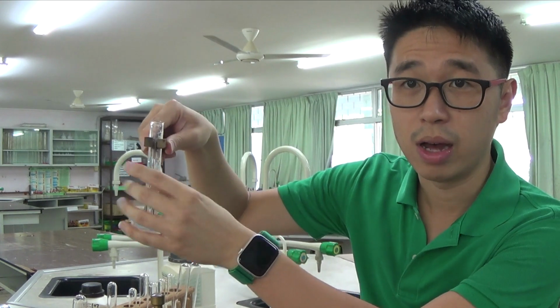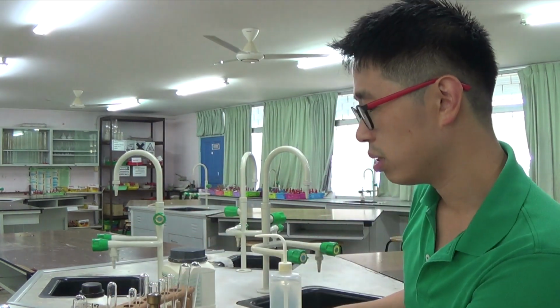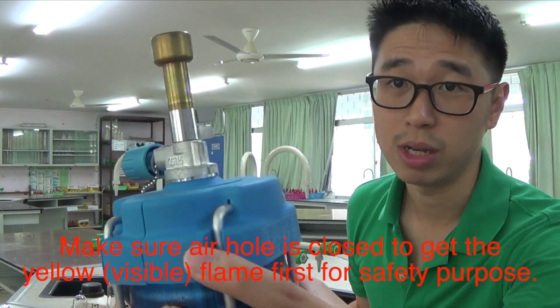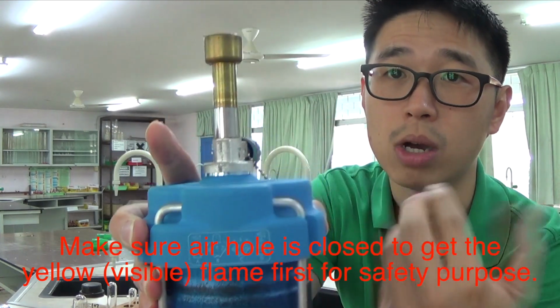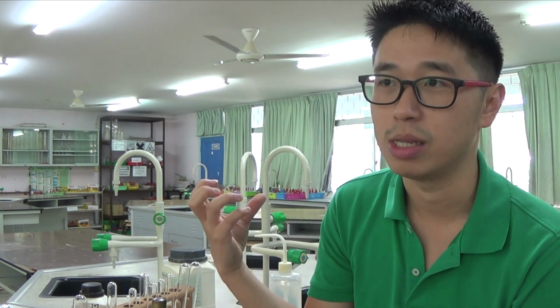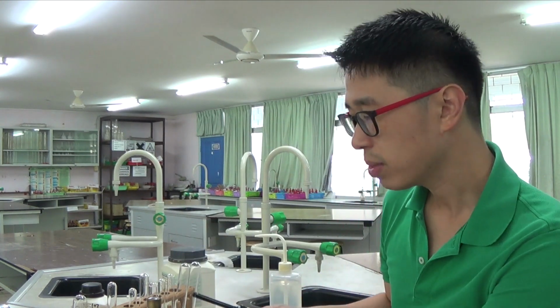So hold it with a test tube holder. Okay, so it's a wooden apparatus, test tube holder. I'm not sure if this is a good idea. I'm sitting in the direction of the aircon. So be very careful when you're dealing with a Bunsen burner. Make sure that when you start your Bunsen burner, the hole is always closed, because you want to ensure that the flame you get first is an orange colored flame. If it is straight away a blue flame, it's very hot, it's very dangerous, you can't see it. So you need to close the air hole to make sure that it's a yellow flame when you first ignite or when you first light up the Bunsen burner.